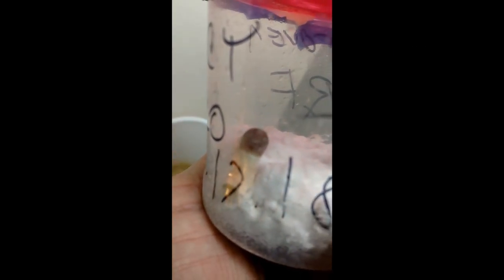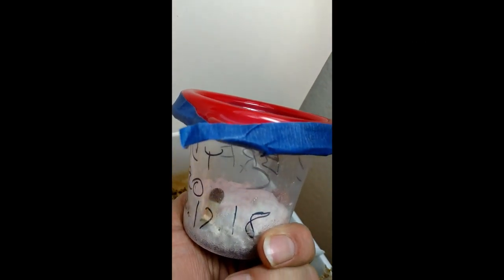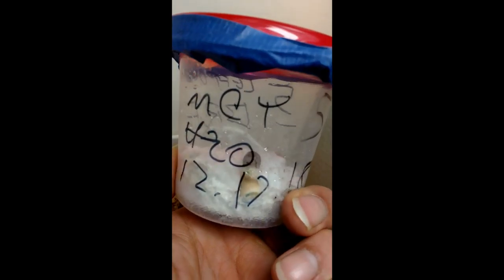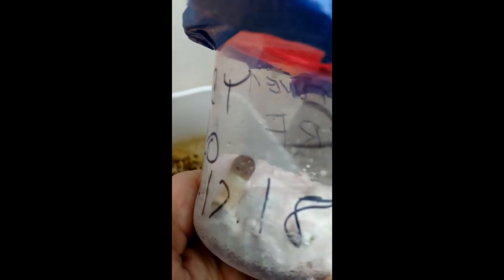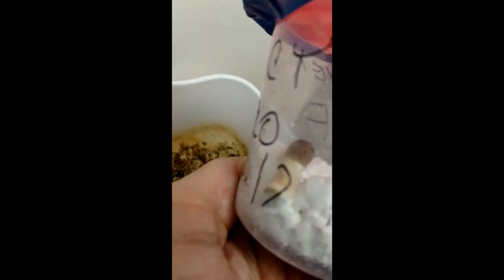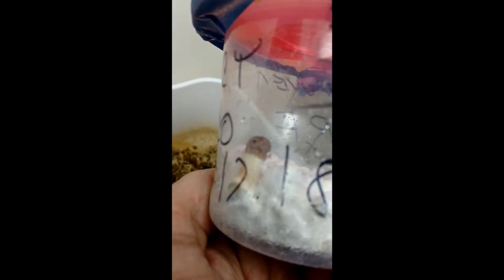There it is — my in vitro fruit. It's in the big red top container. This is mycelium water and BRF. That thing is so aggressive — it's fruiting inside the jar all on its own. That's the one that we want, so that's a keeper. We're going to let that grow a little bit bigger so we can get some more tissue out of it, then harvest it, clone it, and grow it out in some more petri plates. Maybe make some liquid culture with it. A lot of possibilities — looking good.